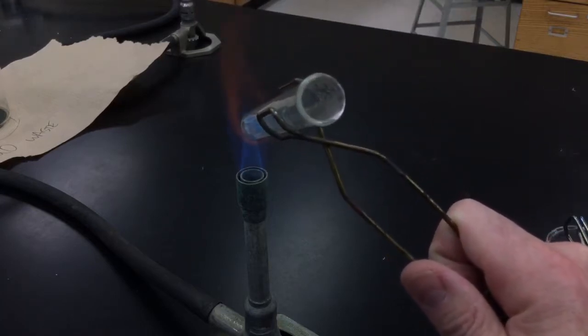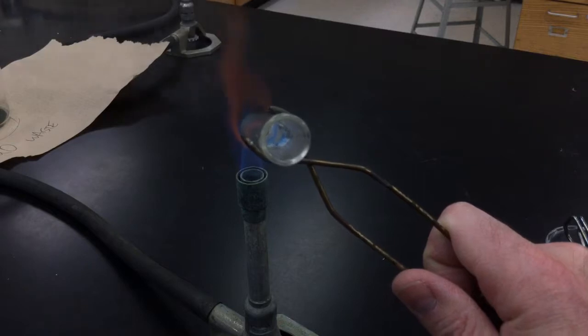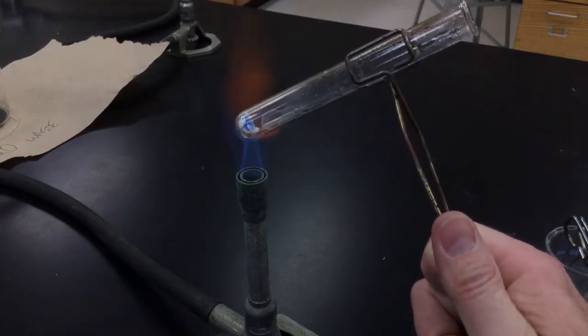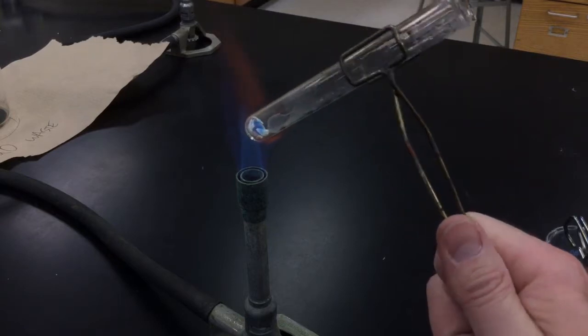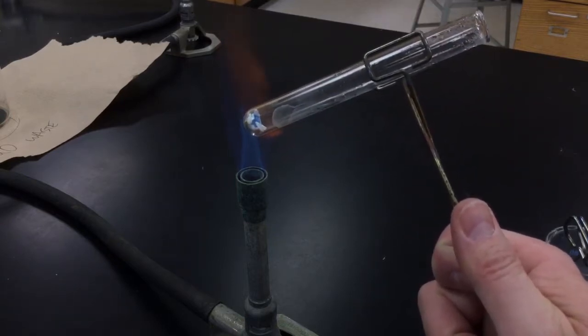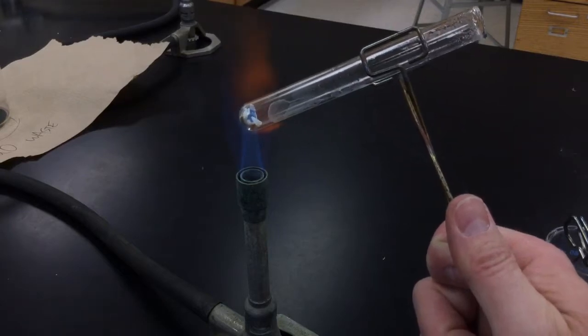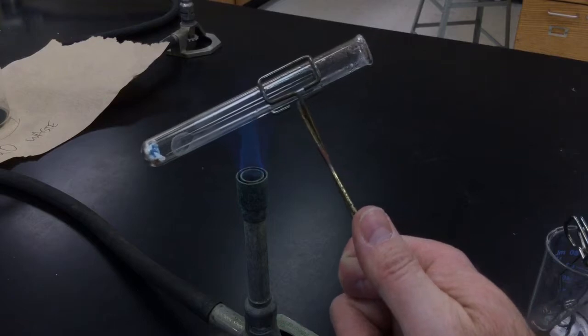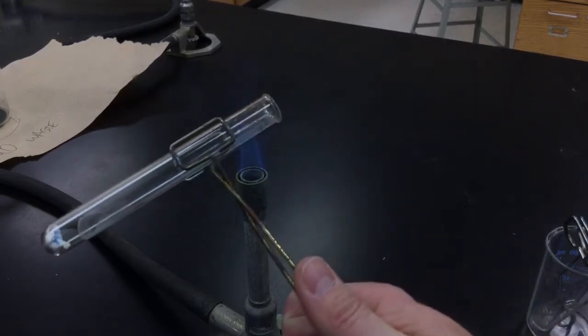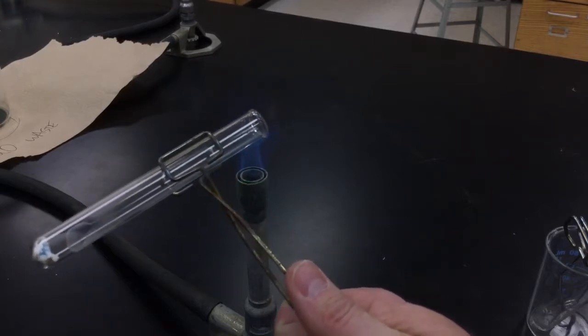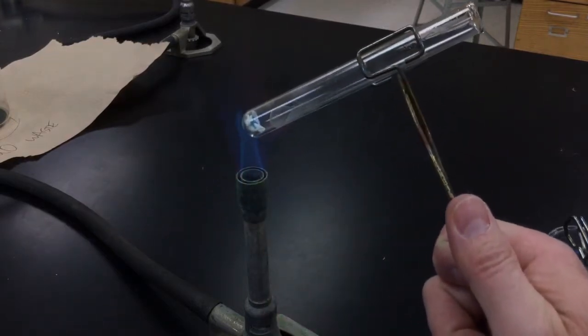Okay, you see some of the steam coming out of there. Trying to boil some of that water away. I don't think we're done heating all of our copper sulfate away yet, but heating up some of that steam out of there would be good as well.